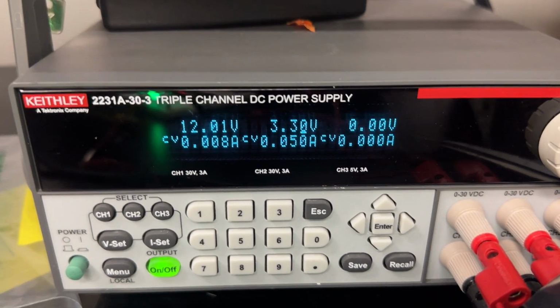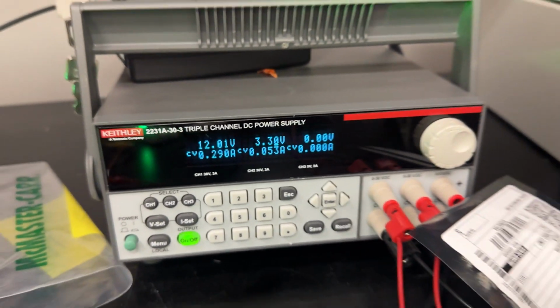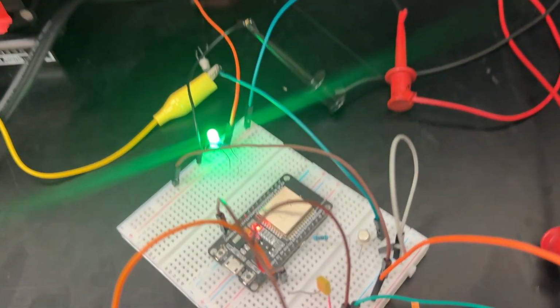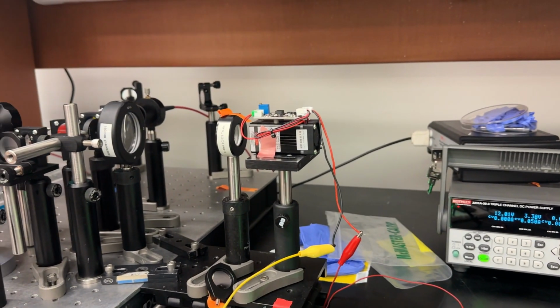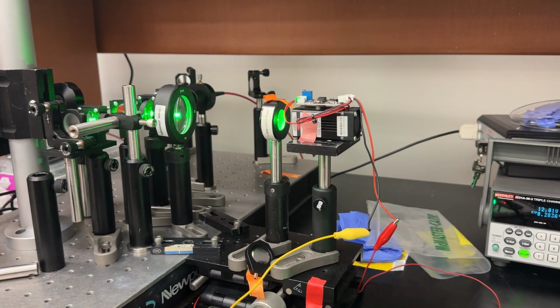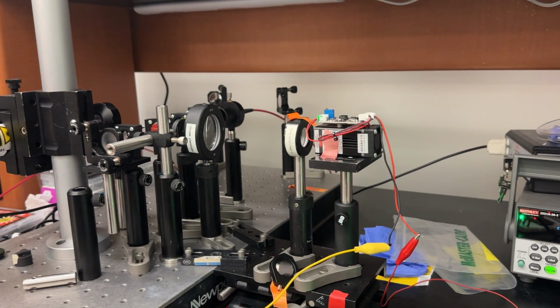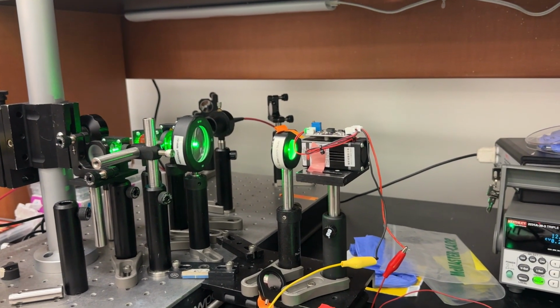Here we have a 12-volt DC input for the laser, as well as a 3.3-volt DC input for the ESP32. The way we have it set up right now is the code is cycling on and off every 2 seconds, pulling the resistor high to low and interrupting the ground connection for the laser, which is turning it on and off. The next step would be to connect it to the Raspberry Pi alongside the LCD display. And instead of it cycling on and off, it would then be turning on and off via input on the LCD display.